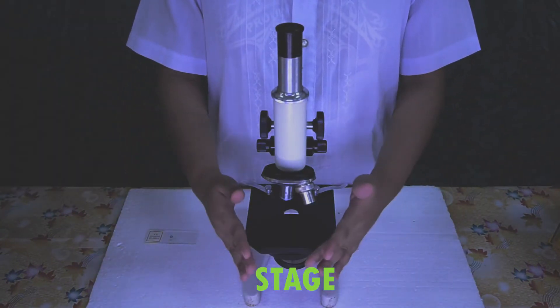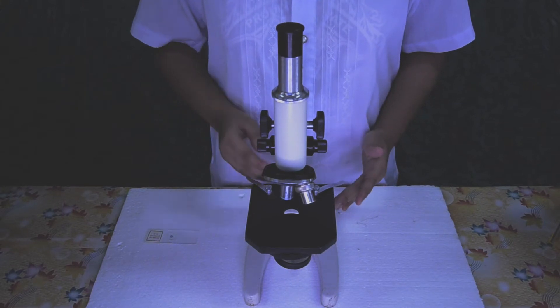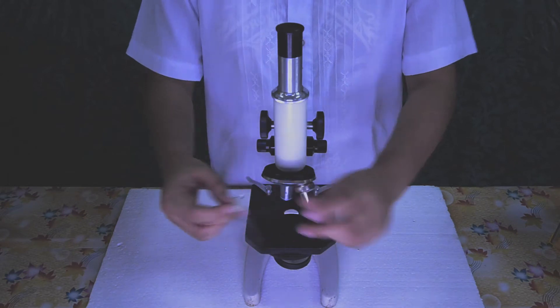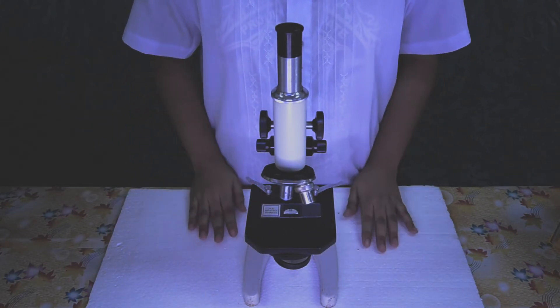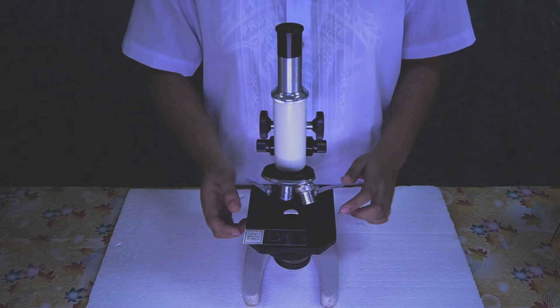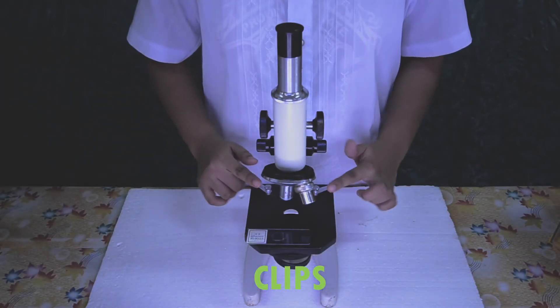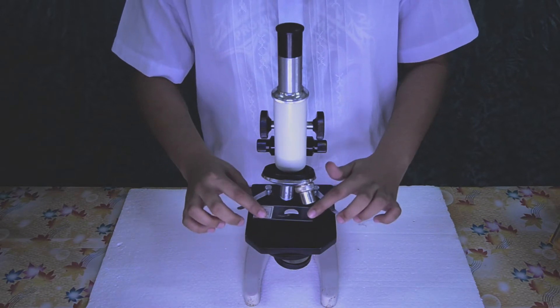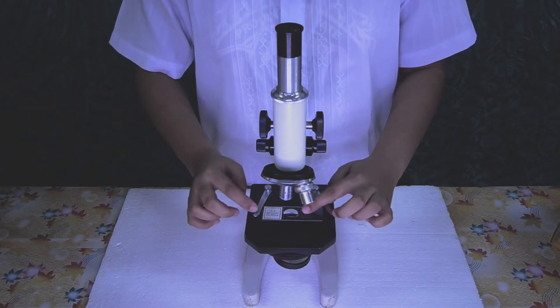Stage. A flat plate attached to the lower end of the arm. A slide or object is placed on the stage and studied. A hole is present in the center of the stage, and light rays pass through this hole. Clips. Two clips are attached on the upper part of the stage and are used for holding the slide in position.